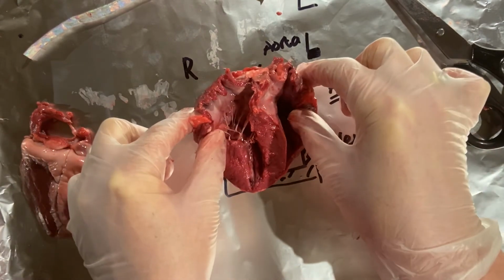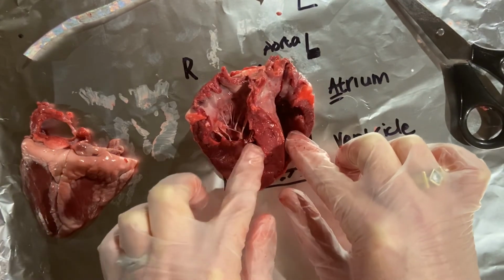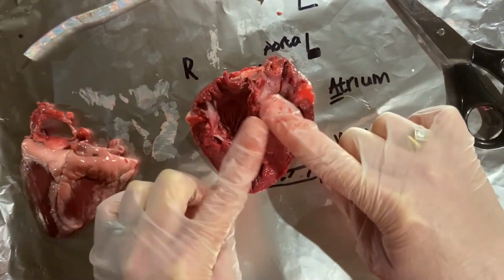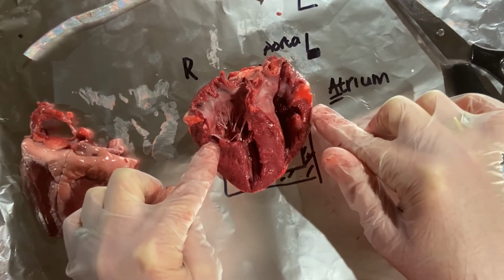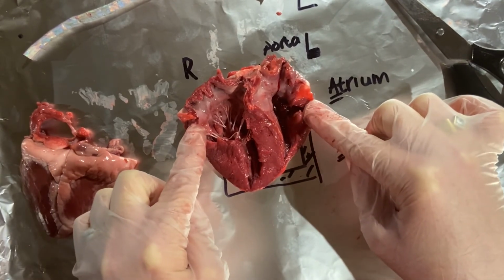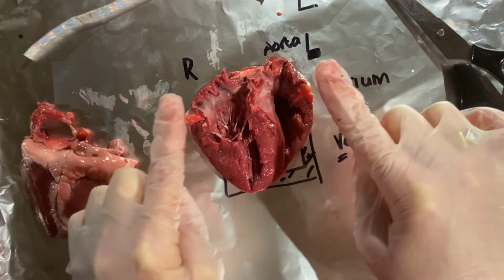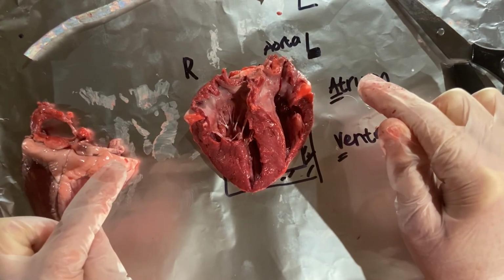Well, I hope you've enjoyed this and not found it too gory. And it's just wonderful to see some of those things that we often only see as pictures in our textbook. Now, you could always try this at home with permission from your parents if you're very, very careful. I got this from my butchers, and sometimes you can get it from good shops as well. And you could try this yourself. If you do, let me know how you get on. And sometimes it's just a bit of a luck of the draw exactly where you make that dissection.